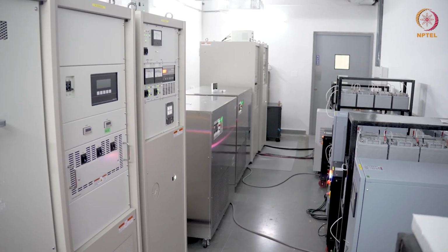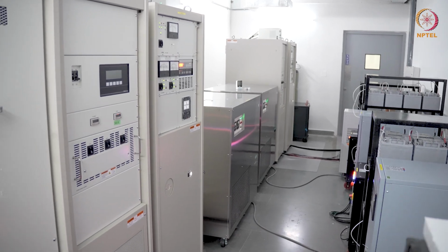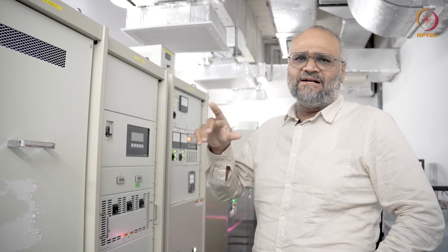Let your facility manager take care that all these components are running as required and the instrument is in good health. But just in case there is some issue, to know where to troubleshoot and to diagnose, I'm showing you a layout of the system. How the software console and the control pad of the microscope is, and we'll go to the instrument console now.